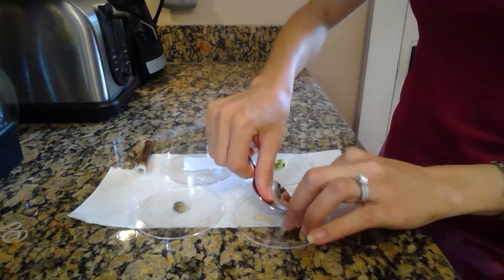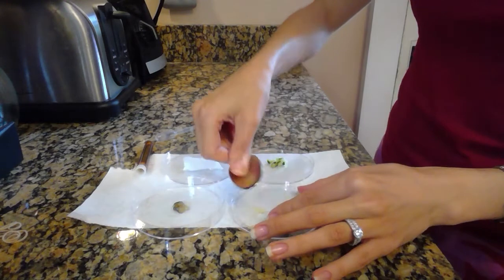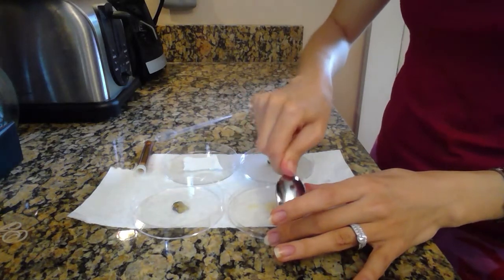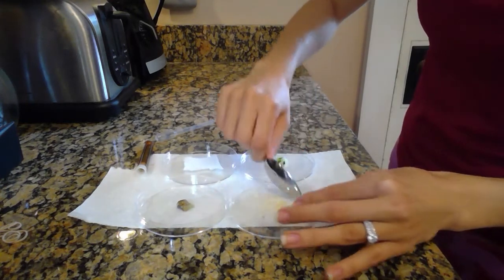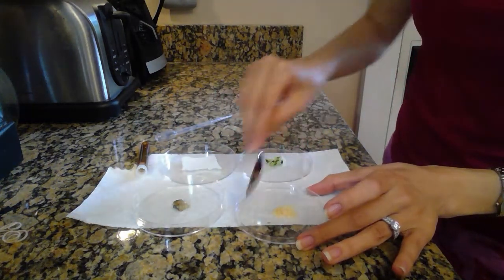And if you have items like my Rice Krispies or pasta or rice, you want to go ahead and crush them and break them up a little bit. So you can use a spoon just to get them into a little bit more of a powder. This just helps your iodine actually get in there enough, right? Thinking about surface area and the contact that it has. So once you crush it, make sure you kind of pile it all up back in the middle.